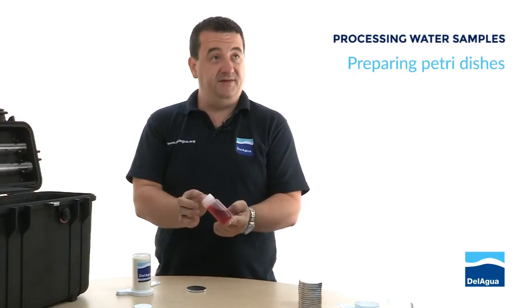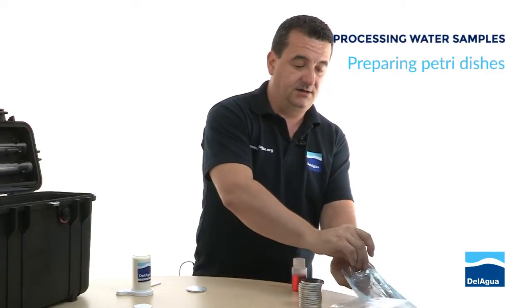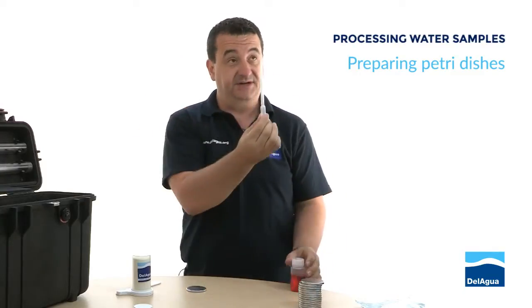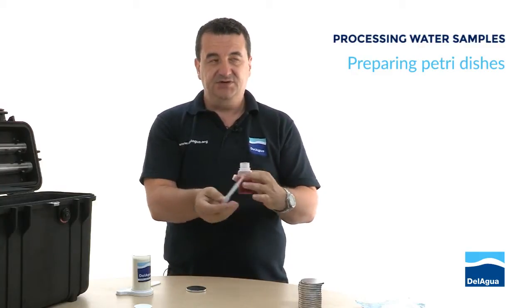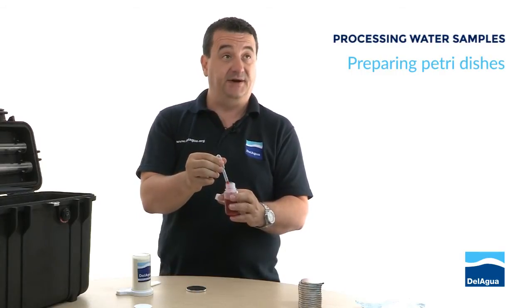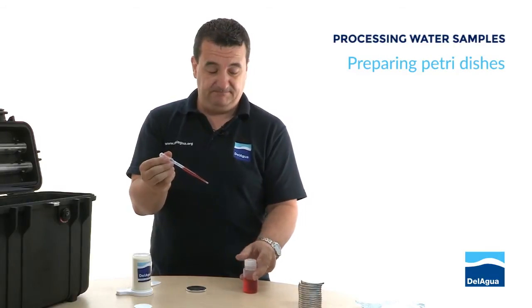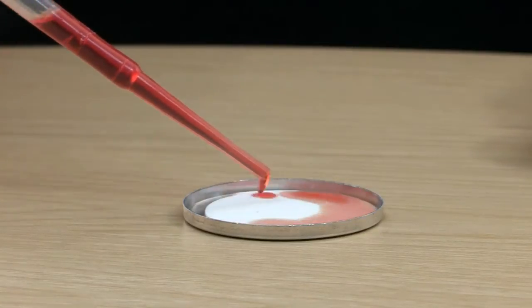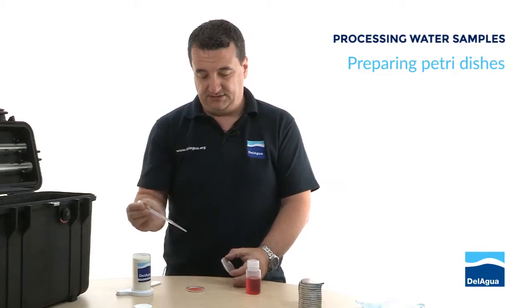Then it's the same process with the media. Remember the nice red media that we made earlier. We're going to take a sterile pipette, holding it at the correct end - not the sampling end, because we don't want to contaminate that. How much media does it take per petri dish? It's between two and two and a half millilitres. Each pad is very slightly different in terms of the amount it will soak up, so you need to judge it by eye.